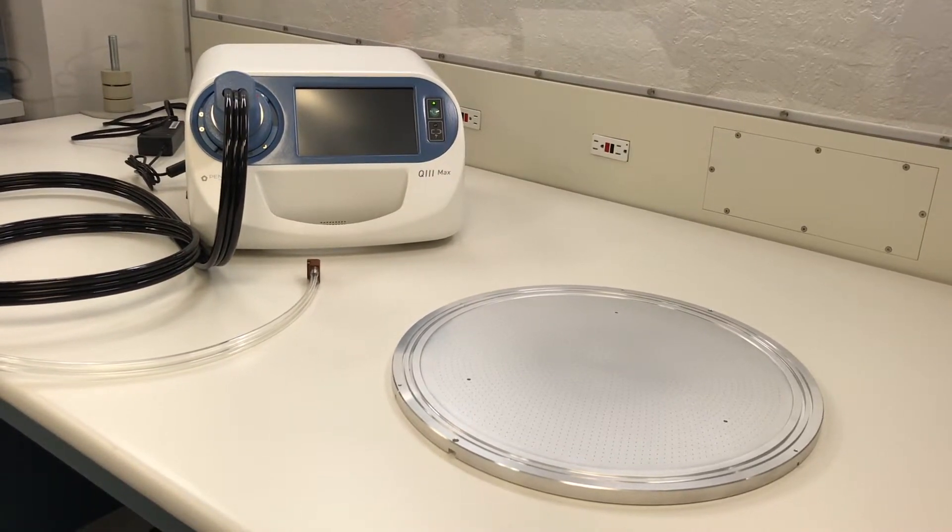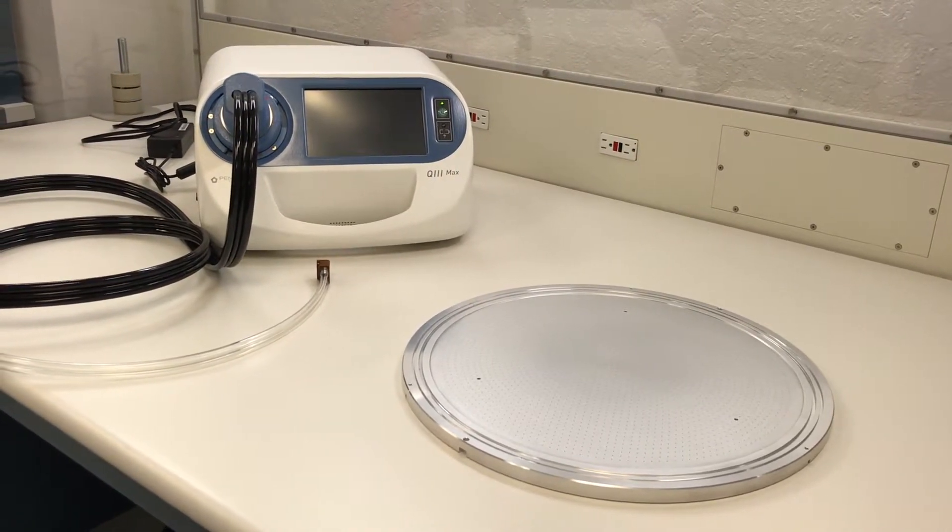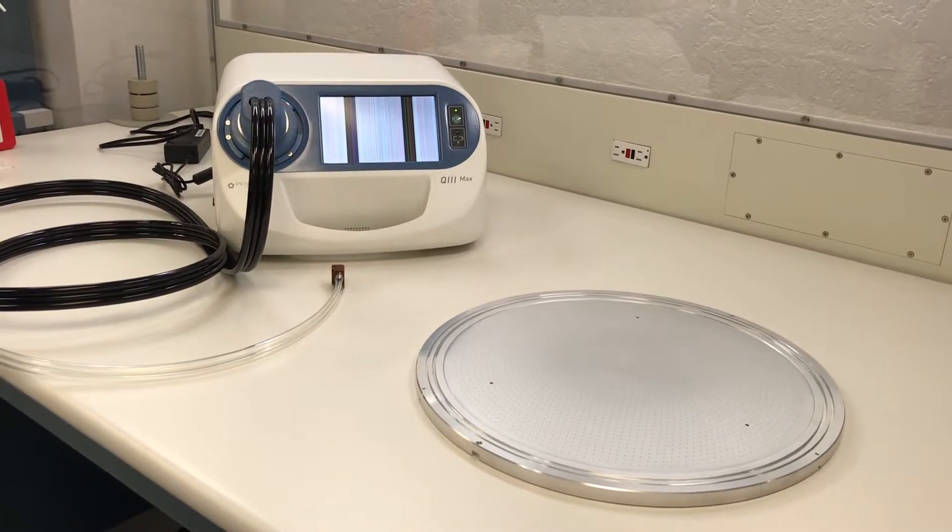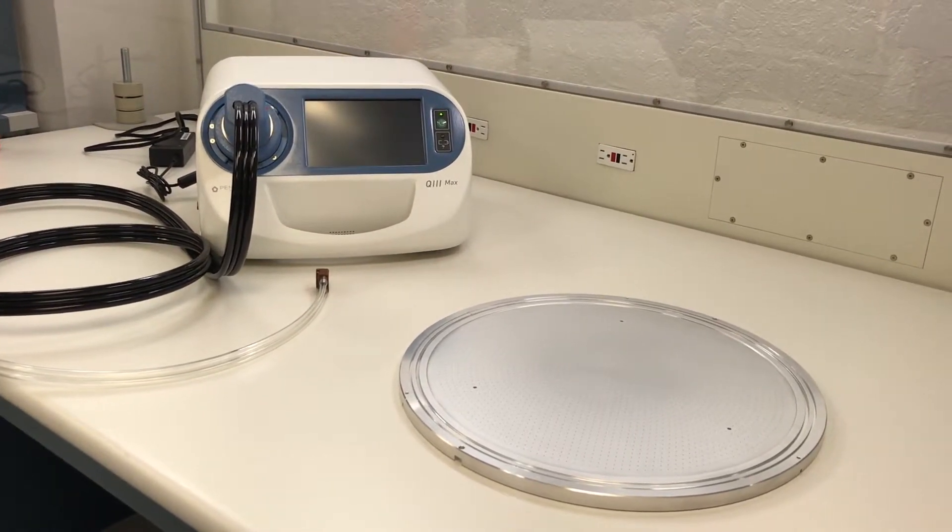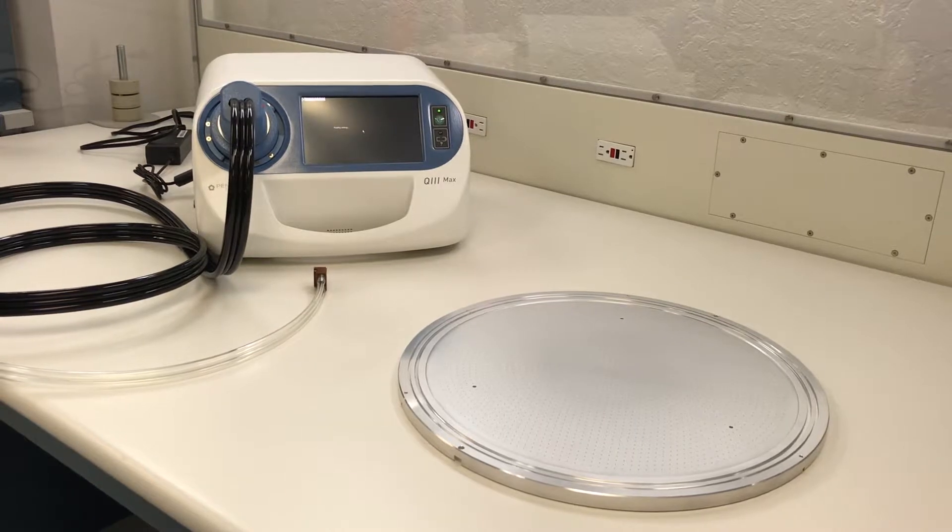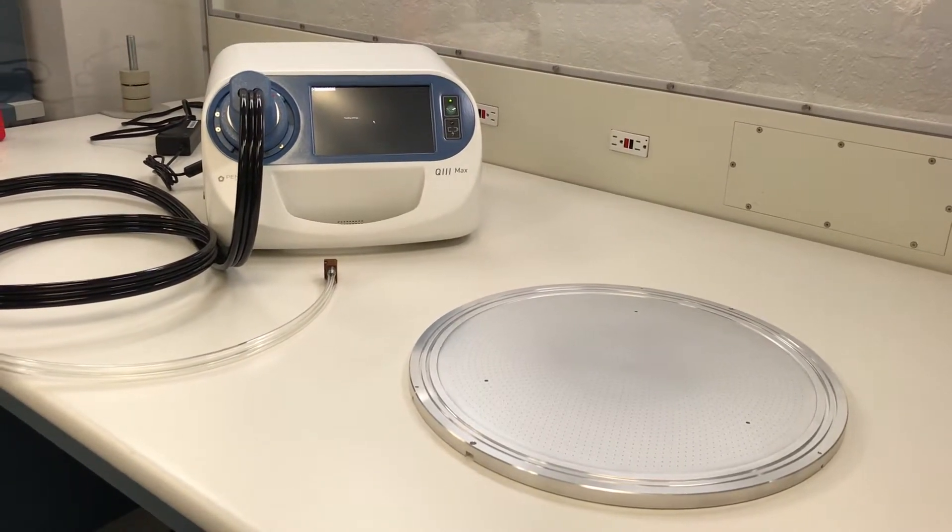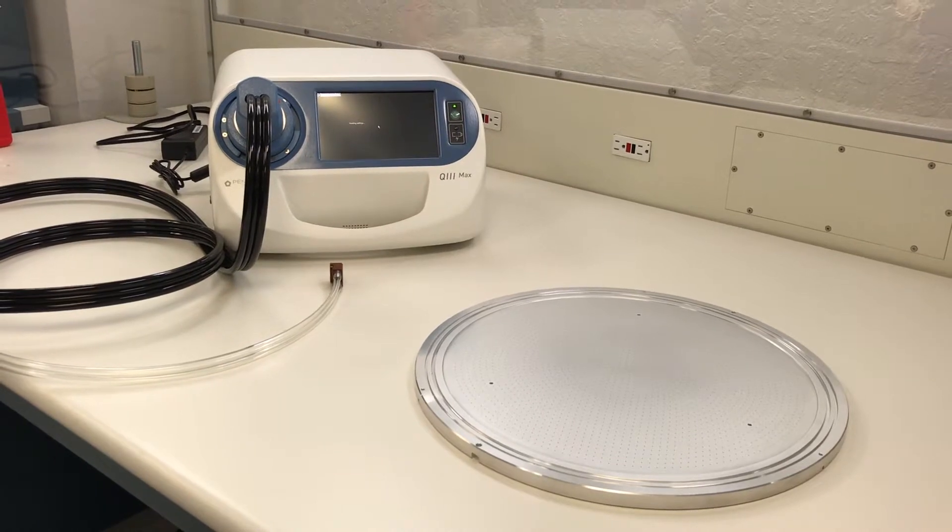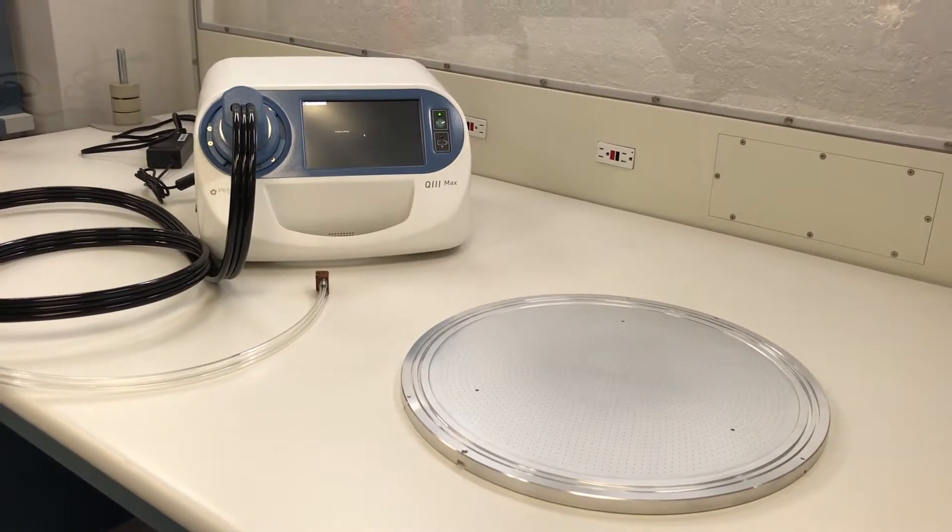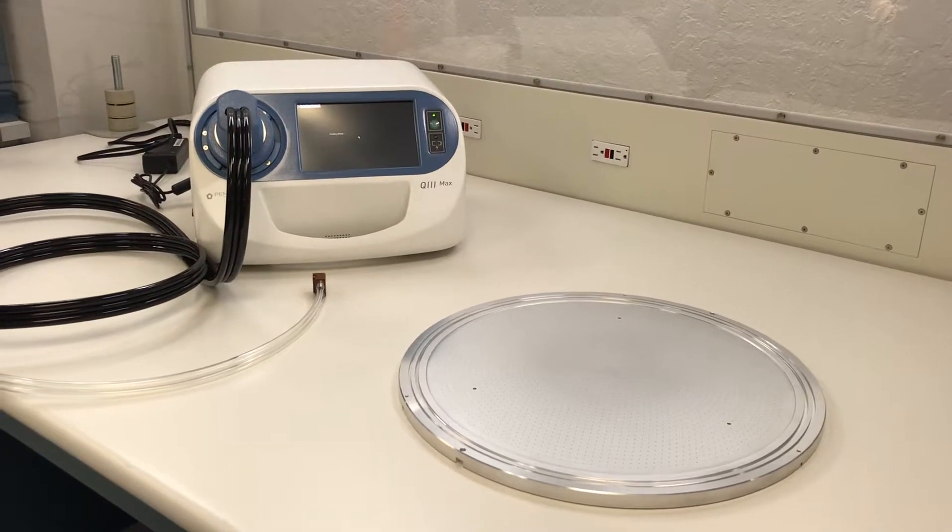For this demo we are on an ISO class 4 clean room workstation built by Pentagon Technologies. This environment has HEPA filtration so the air is very clean. The boot up takes about one minute, so please do not touch the system while it comes ready.